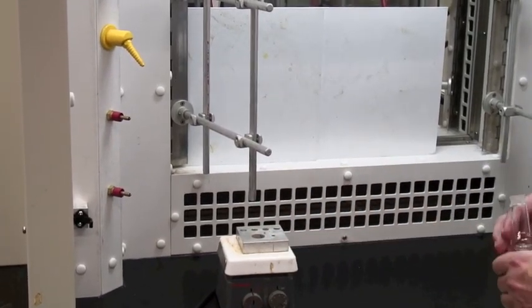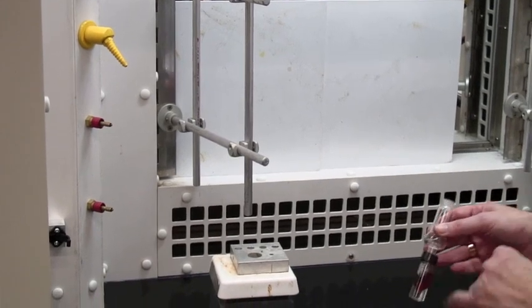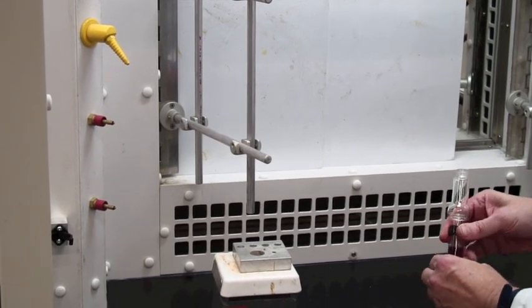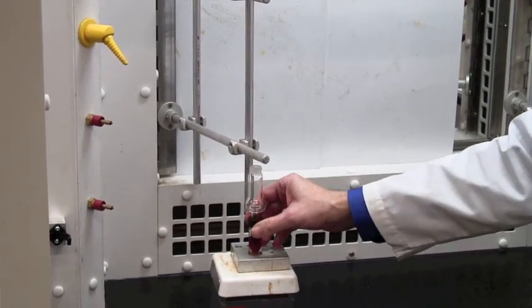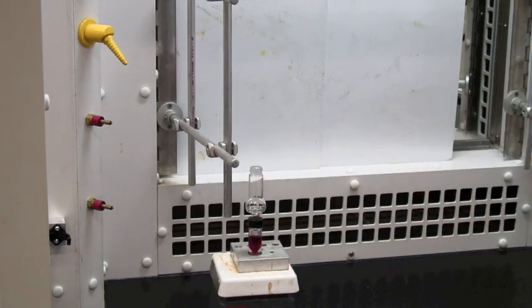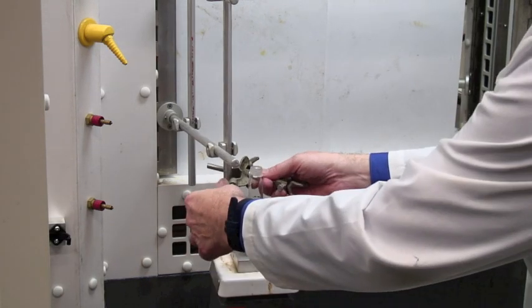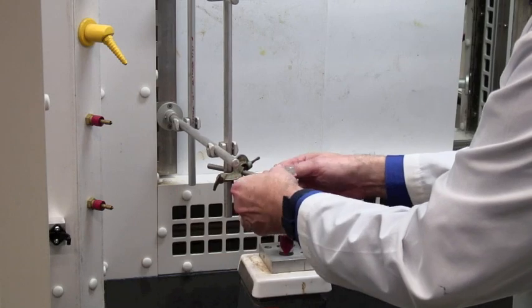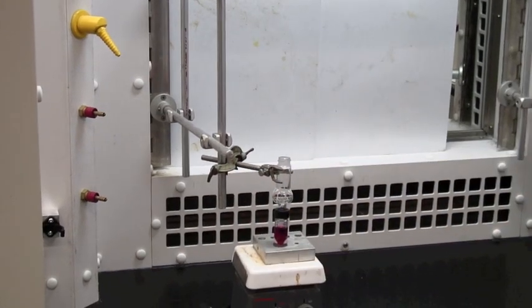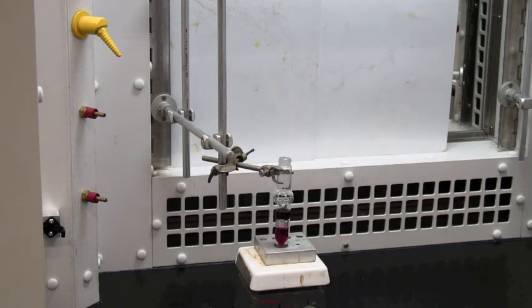I've assembled the vial and the Hickman head here, and that will stand right there. I'm going to need to move the scaffolding just a bit. And take a three-finger clamp and affix this properly. And clamp to support that properly. You'll notice I've got that spinning already. We now want to have the condenser moving in.